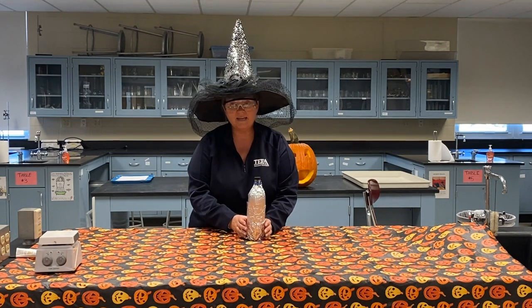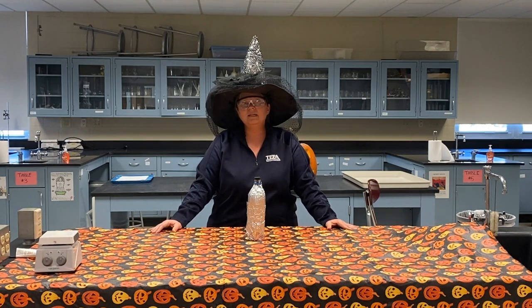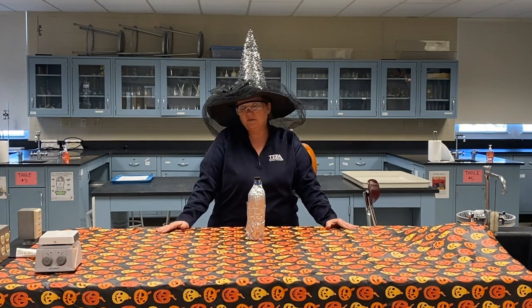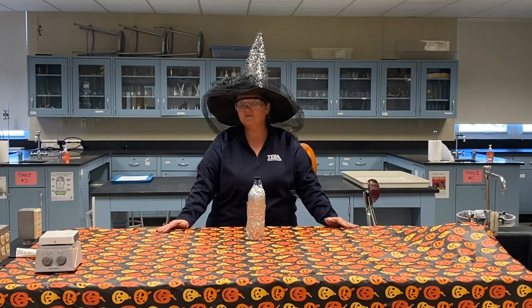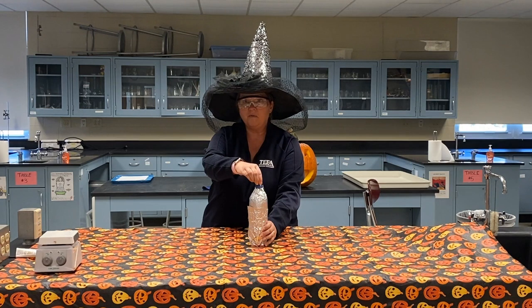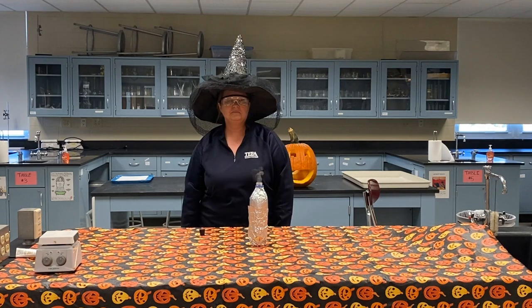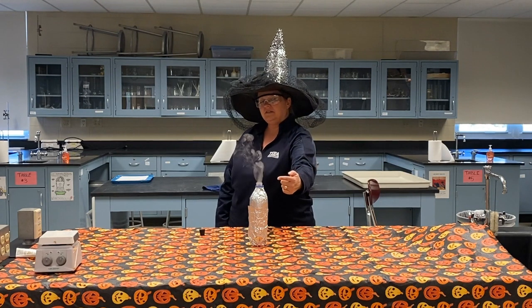Conestoga has been a quiet, eerie place for a long time since our shutdown back in March. And it's given me plenty of time to, just like Ghostbusters, spend hours upon hours from hallway to hallway collecting ghosts and trapping them here in this bottle. So now that we're converting back to hybrid instruction and we're slowly filling up the hallways of Conestoga, I thought this was a perfect time to let those ghosts out. So be careful when and if you make your way back here, watch out for those ghosts. You want to be paying attention right here to the mouth of the bottle.